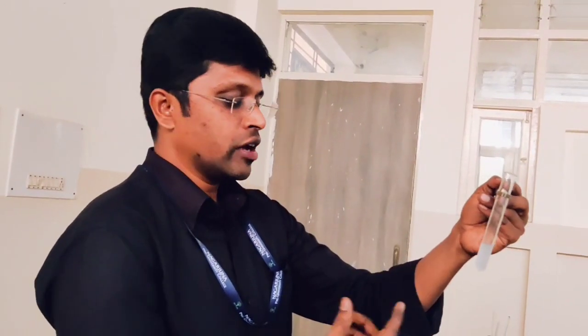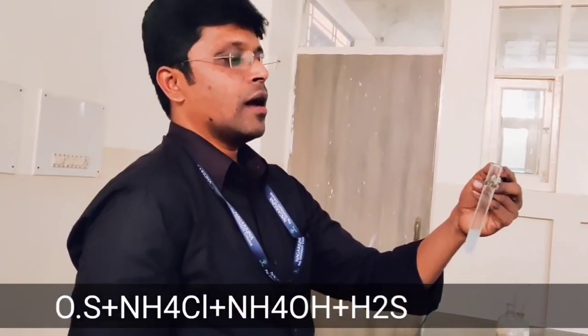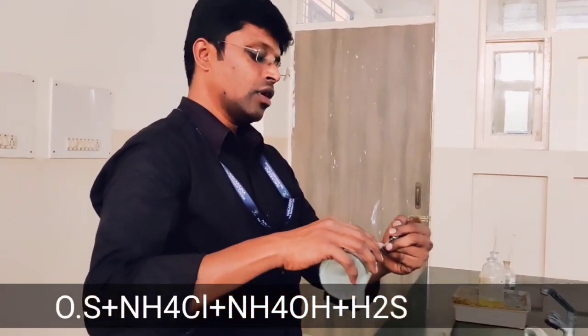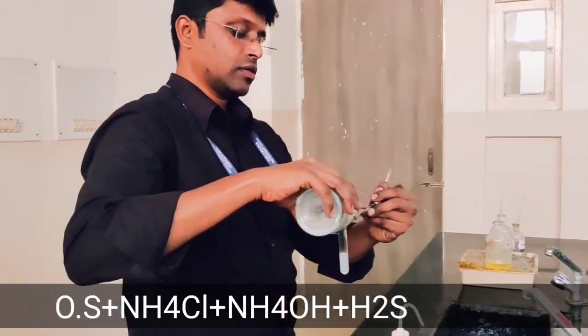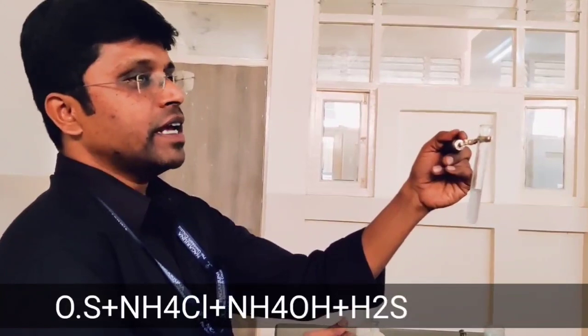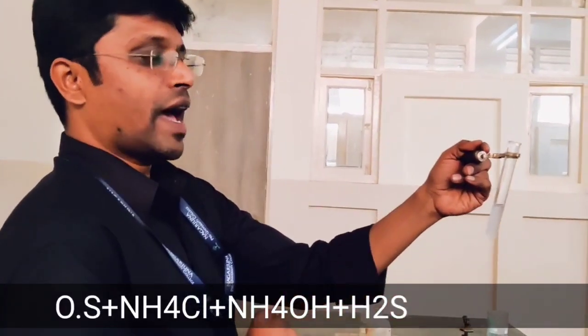With the same solution, we can add H₂S, which is the test for fourth group basic radicals. Because the reagents for third and fourth group are similar, there is no need to discard the solution. The only extra reagent we add is H₂S. After adding H₂S, we are not getting any precipitate, which shows that fourth group basic radicals are also absent.